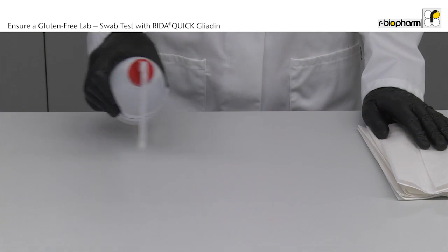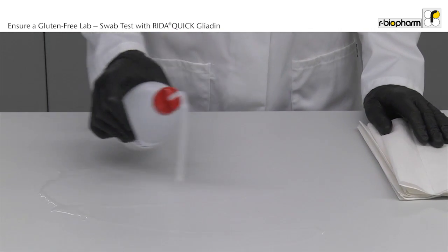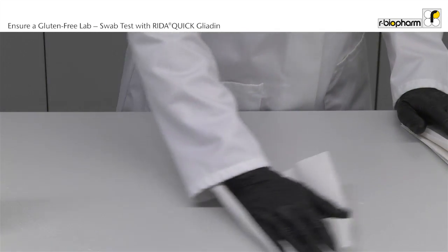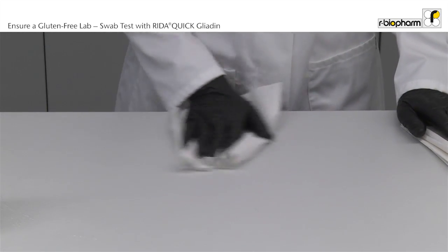Before starting with food analysis, make sure that the surfaces and the equipment used are clean. Use 60% ethanol or isopropanol to wipe surfaces and to rinse vessels.